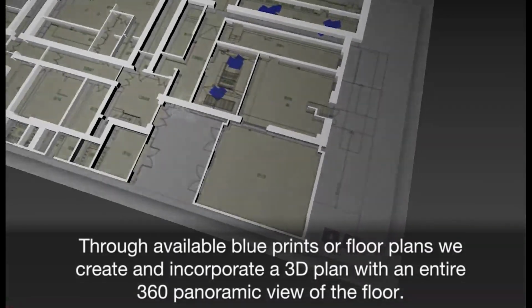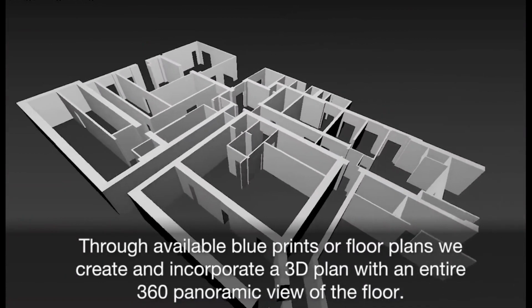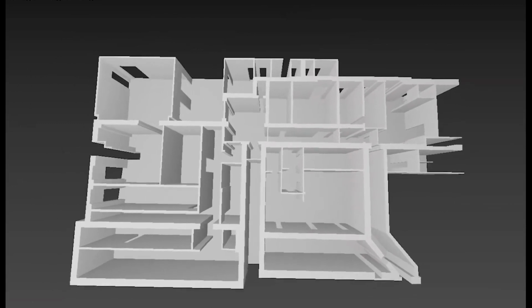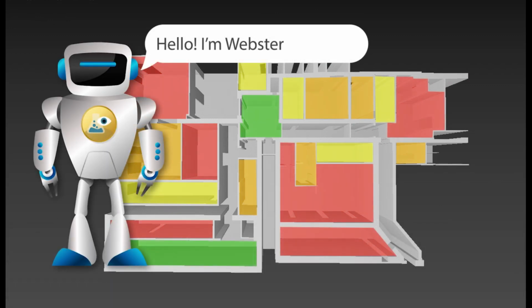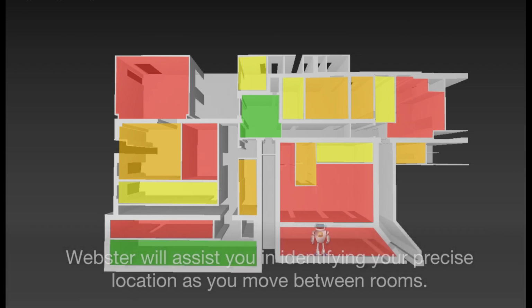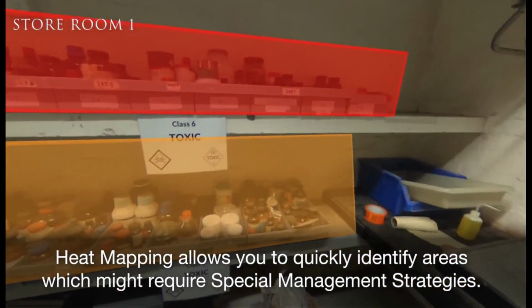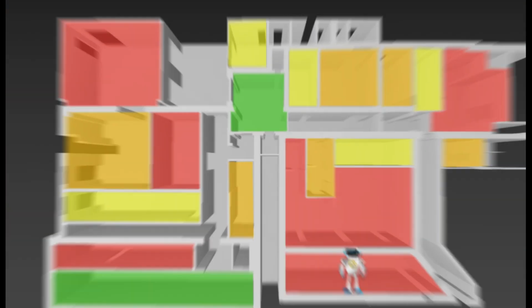Through available blueprints or floor plans, we create and incorporate a 3D plan with an entire 360 panoramic view of the floor. Heat mapping can be applied to rooms or even storage areas within rooms. Webster will assist you in identifying your precise location as you move between rooms. Heat mapping allows you to quickly identify areas which might require special management strategies.